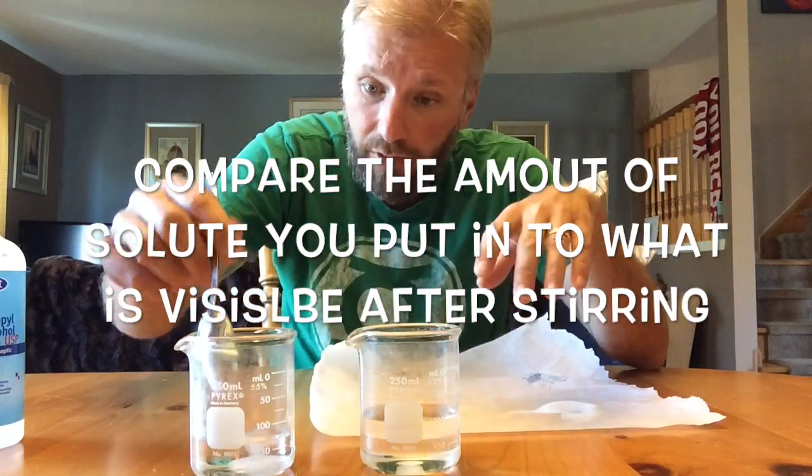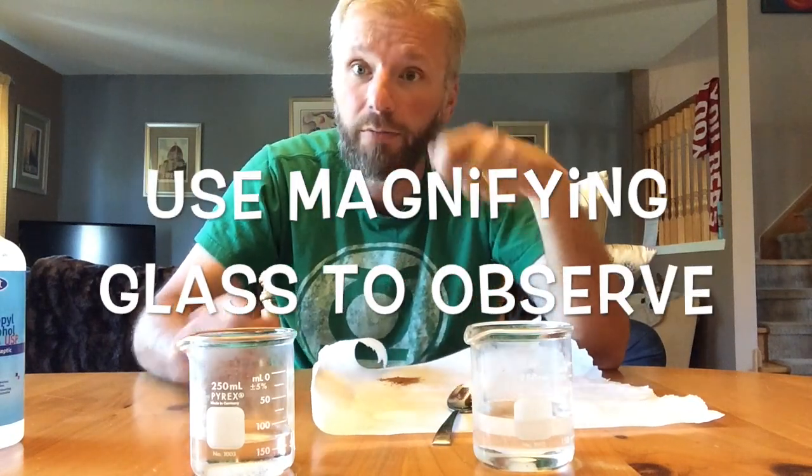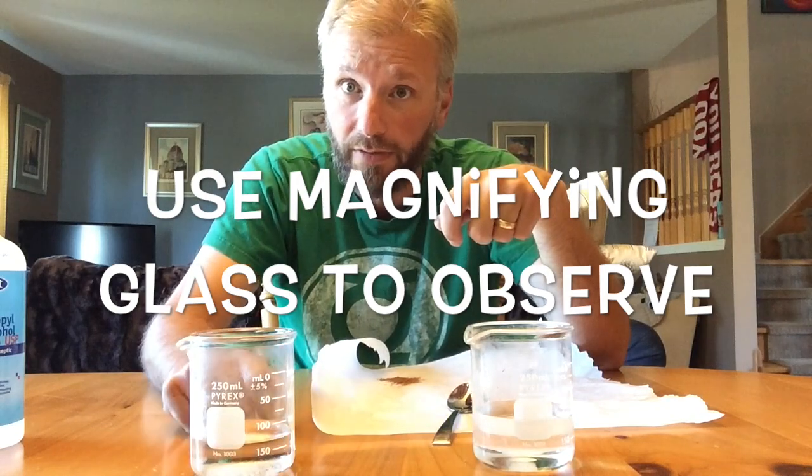All right, I'm going to dump it in here, give it a stir, and compare. I'm not going to compare it to the water. I'm going to ask, do I have the same amount of crystals? Is it relatively the same? A couple of things we can do because they can be hard to see. One, you have the magnifying glass at the back. You can use the magnifying glass.